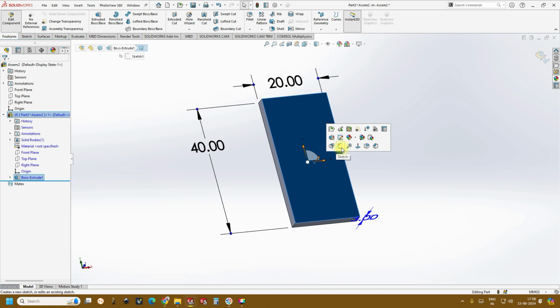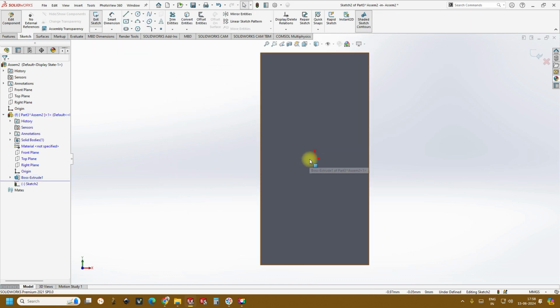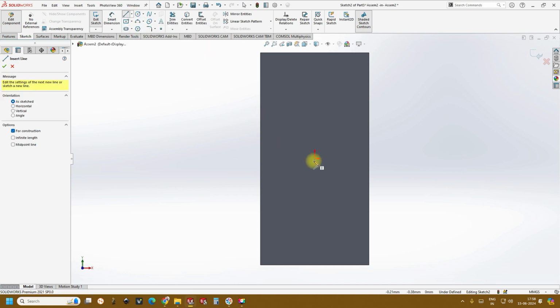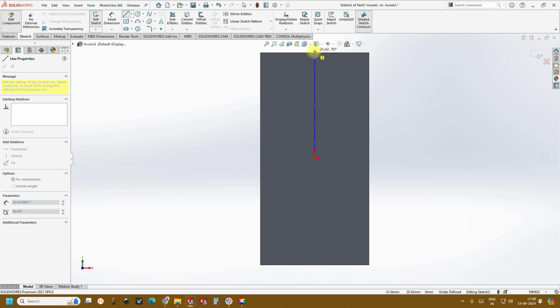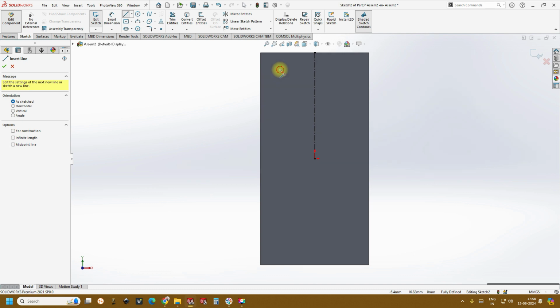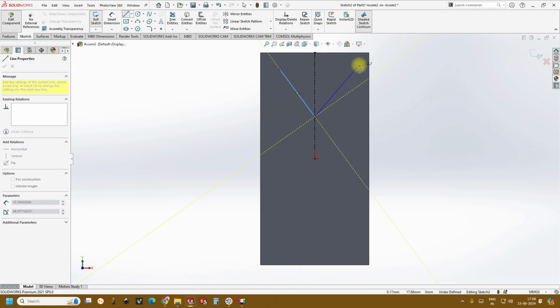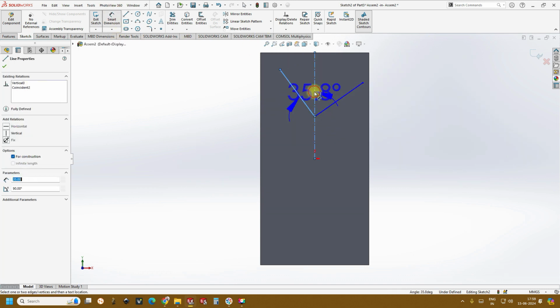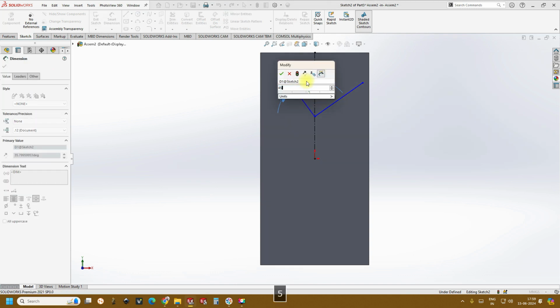Okay, so now again click on this, create a sketch, and this is a very important thing. This sketch is very important because after this we'll extrude cut it, and then we create the channel. So first let's create a center line. This is for reference, and then create a Y. Okay, so you can see, and then let's create an angle in between this. This should be 45 for us.